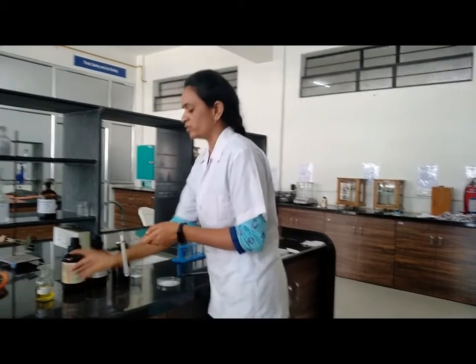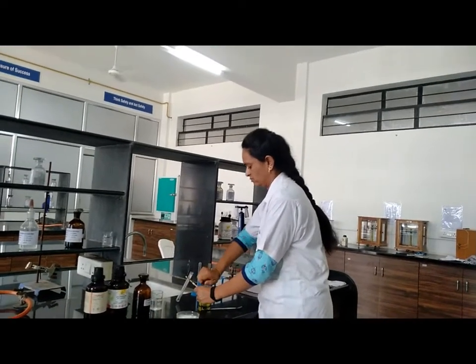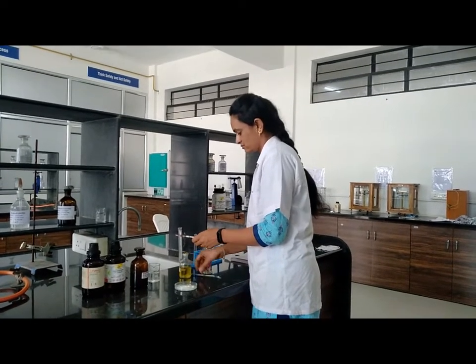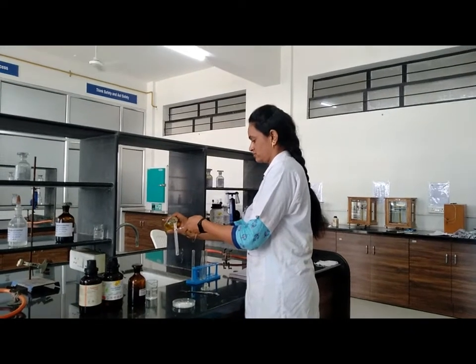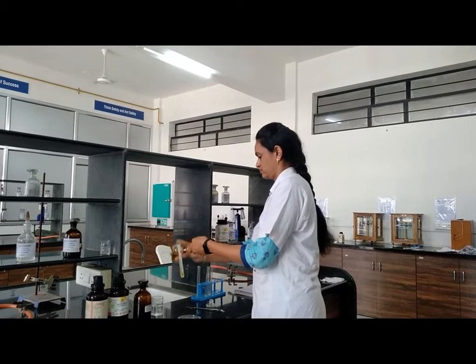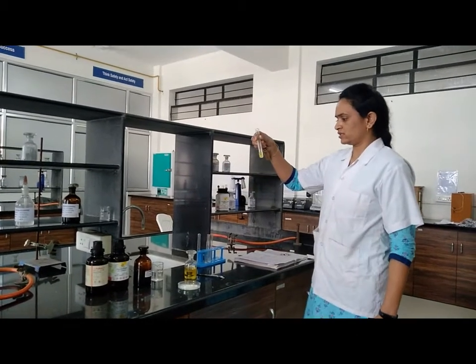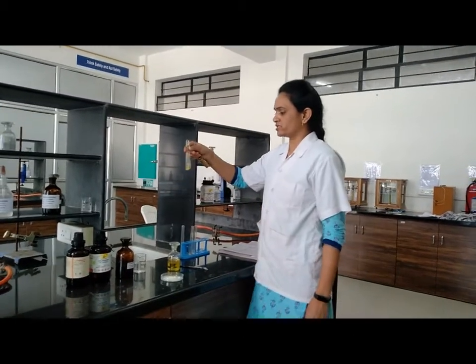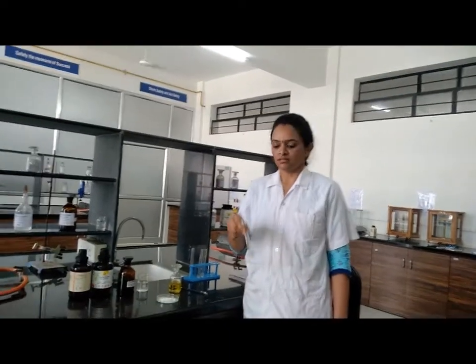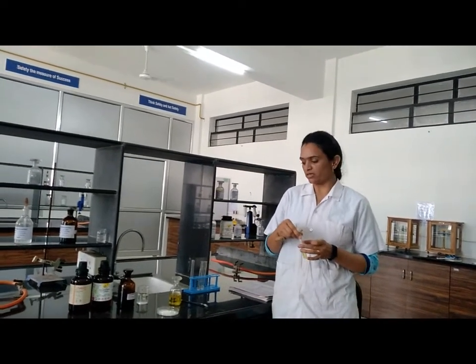Check solubility in benzene. Ascorbic acid is practically insoluble in benzene. In this way we are performing the solubility test in water, alcohol, chloroform, ether, and benzene.